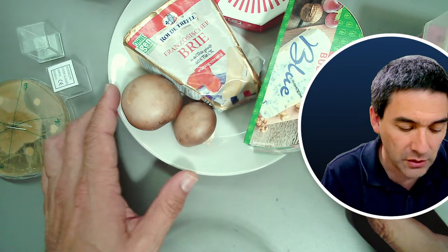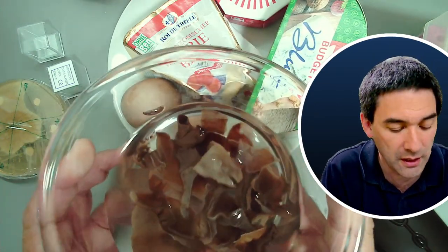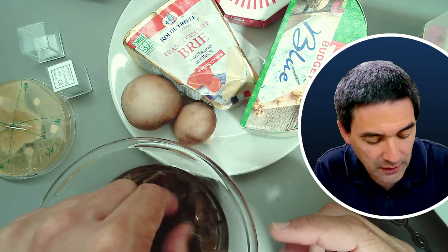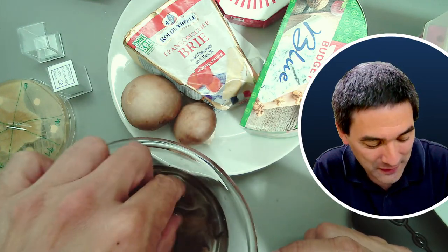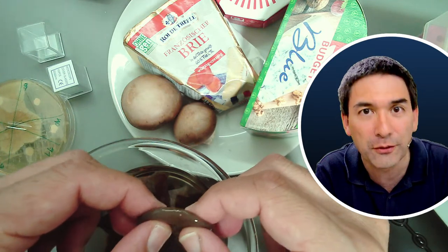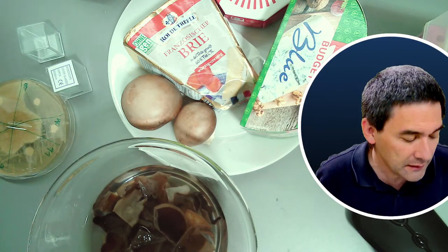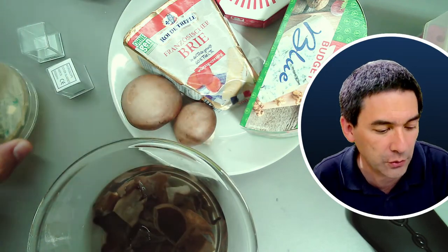I also have what you may have seen in one of my recently released videos — these are the so-called black wood ear mushrooms. I'm not going to eat those anymore because they've been in water for a couple of days, but I pulled them from food and would like to put them under the microscope. I also have an interesting fungal contaminant on a petri dish over here that I'd like to talk about.